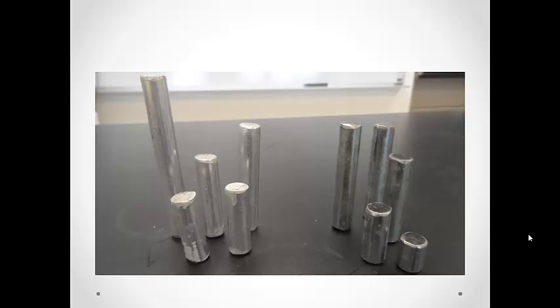We have these little pieces of two different types of metals. If we want to find the relationship between the mass and the volume, we're going to need to determine the mass and volume of each metal.